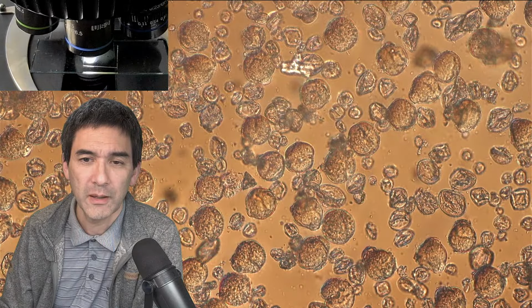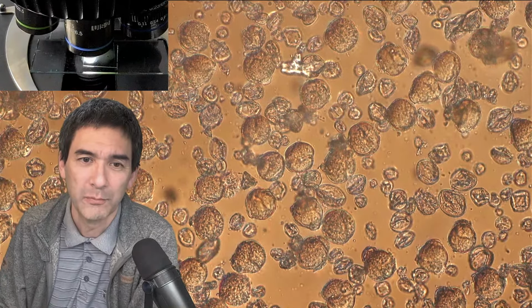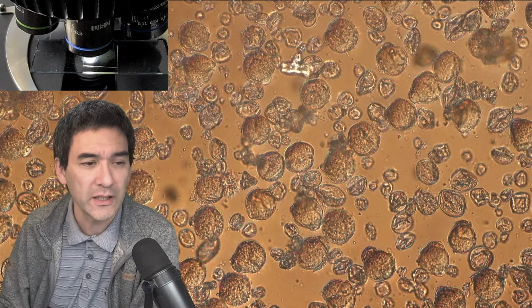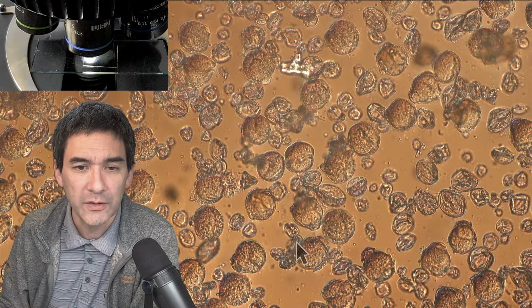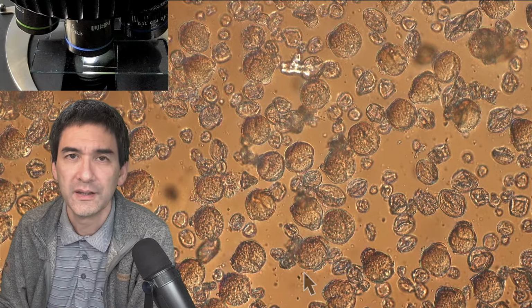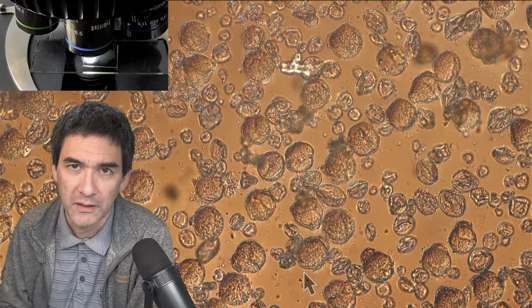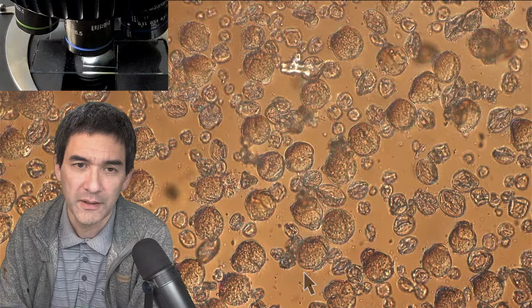So far, only accidentally once could I find a couple of pollen that were actually growing pollen tubes. I can show you how this would look. Here's an arrow. If we take this pollen grain there, then something would start to grow out of the pollen, and this would contain the gamete, basically the sperm cell to fertilize the ovule in the flower.